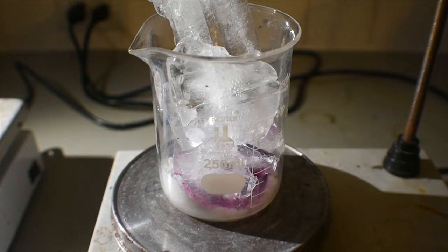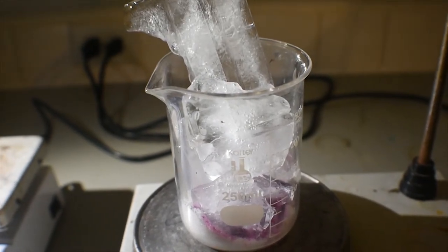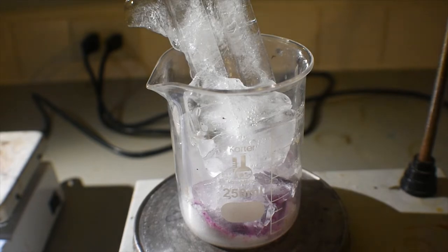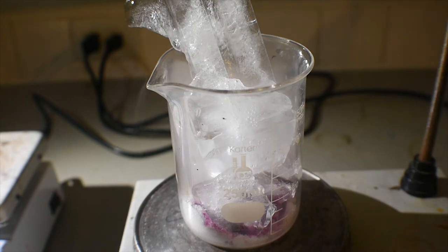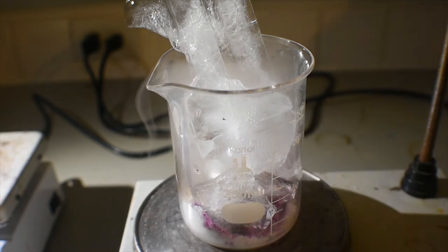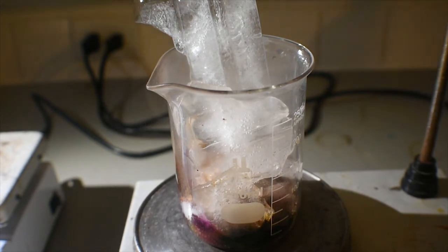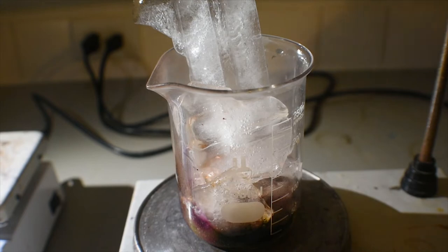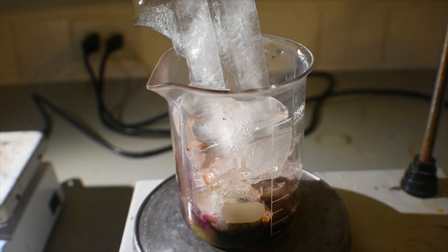I think it's starting. Oh, oh god, oh god, please be gentle, please. Is this going to explode? Is it okay? I don't like that. Ooh, lots of pretty colors though. Oh, okay, I think it's not gonna be too crazy.